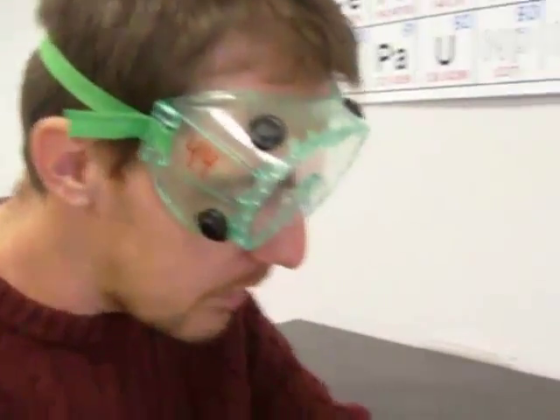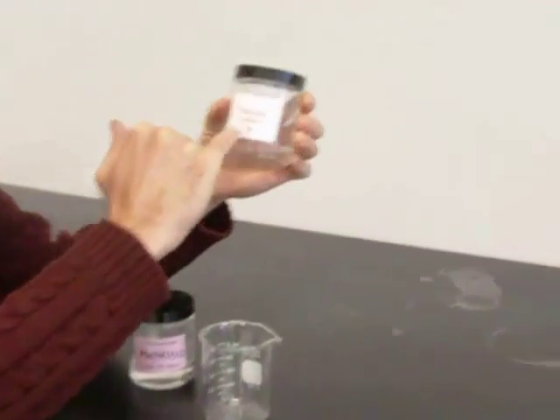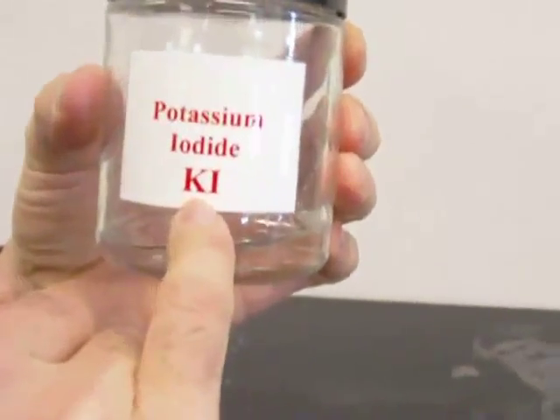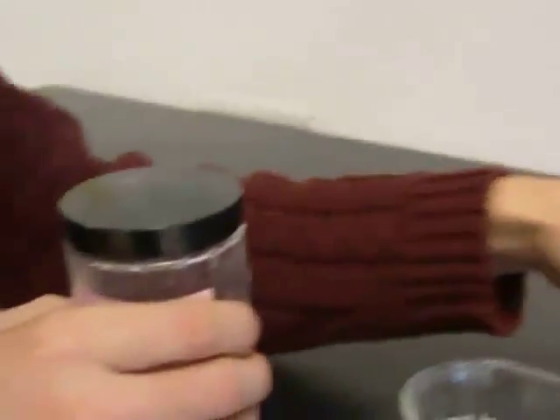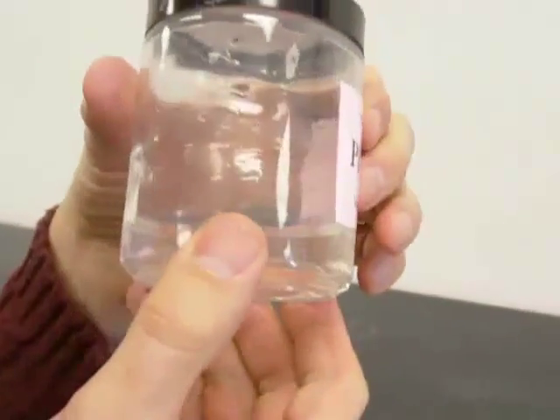A double replacement reaction occurs between two ionic compounds that are in solution. Here I have a solution — meaning dissolved in water — of potassium iodide, KI. Notice it's a clear and colorless liquid. Here I have a solution of lead 2 nitrate, also a clear and colorless liquid.